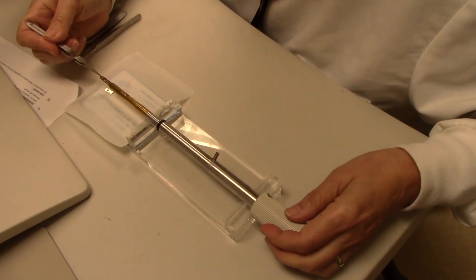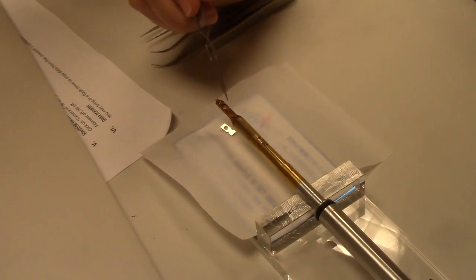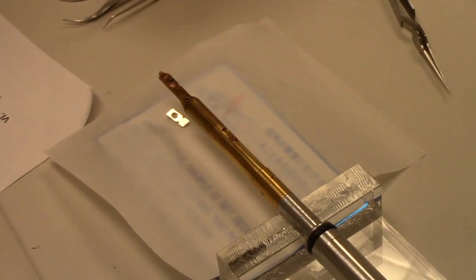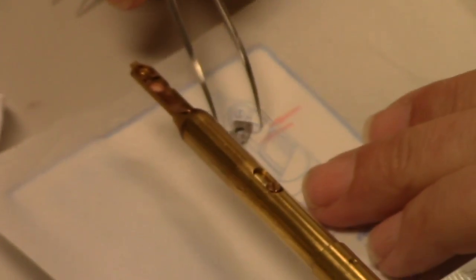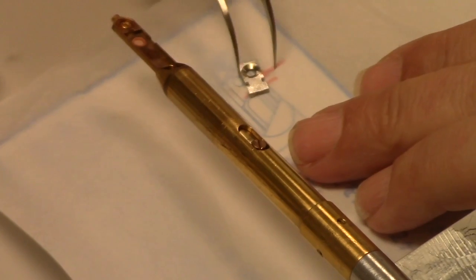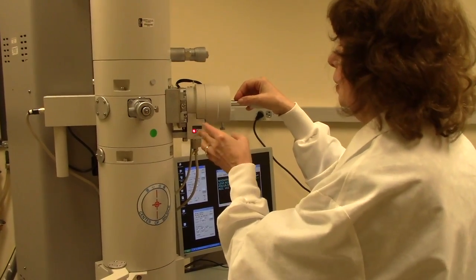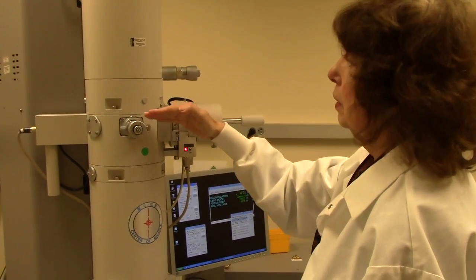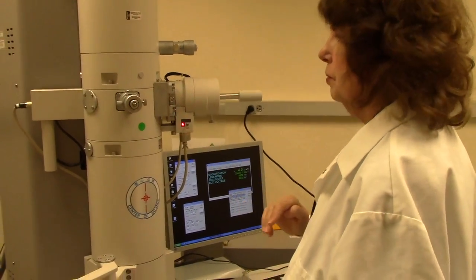This is the specimen rod that holds that little grid that we saw in the cutting room. This has our sections on it that contain our spores, and we are loading that grid right into the holder. Now we're going to put our grid into the path of the electrons — remember, the electrons are coming down the column — so we're going to put our grid right about here and the electrons will interact with our sample.